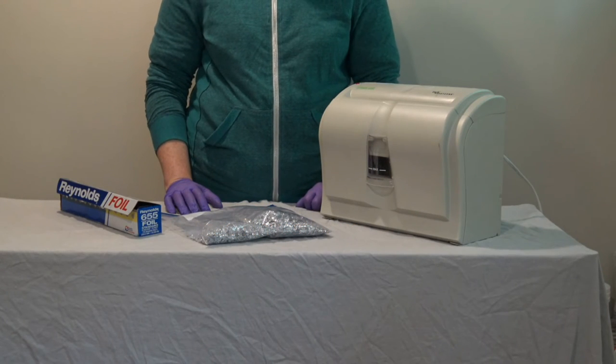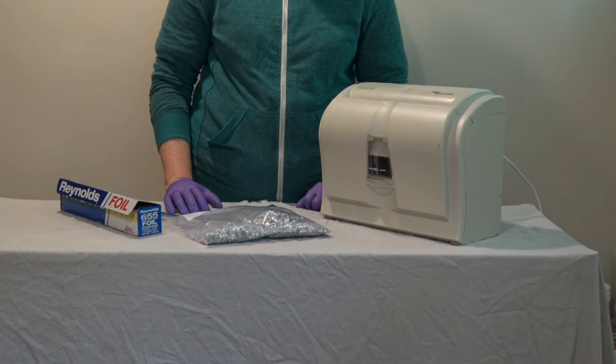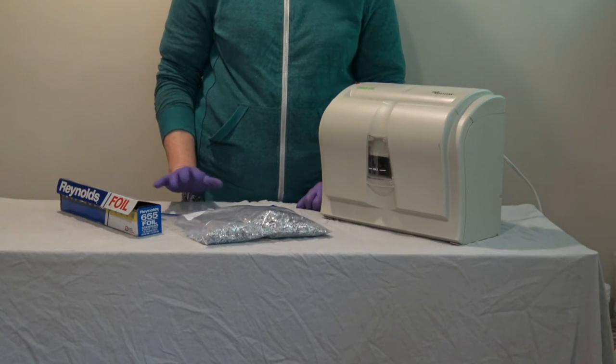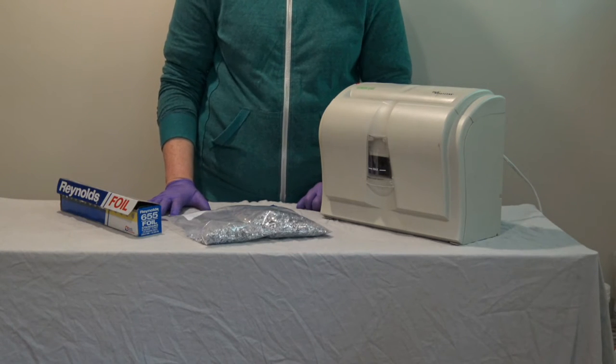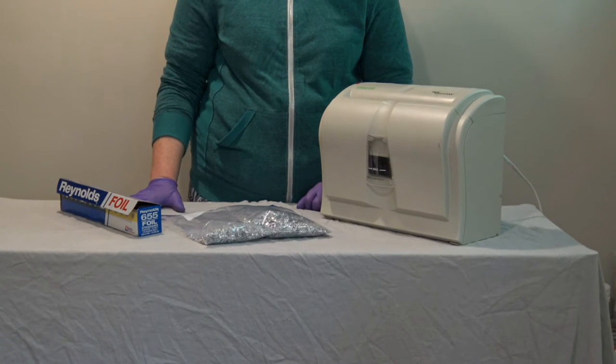In this lesson, groups D and E will be measuring the temperature increases caused by the mixing of root killer and aluminum foil and salt water. This is a chemical process that students will move forward with and use throughout the rest of the unit.